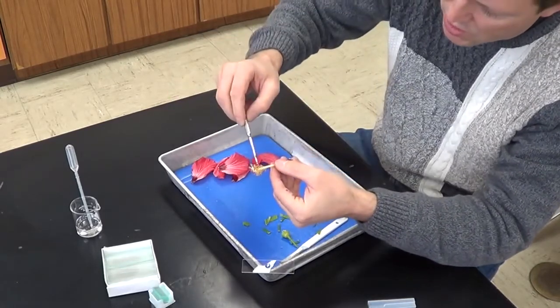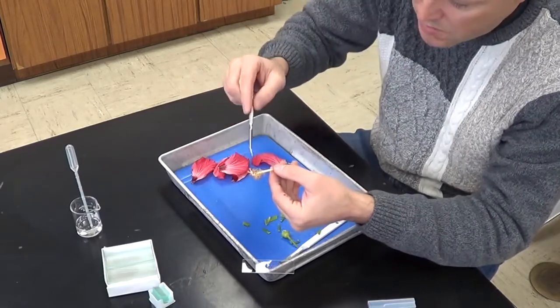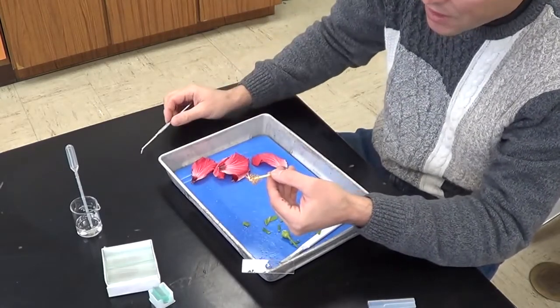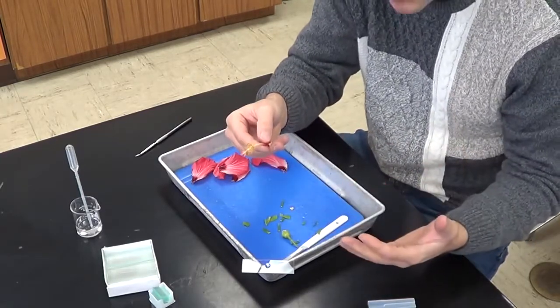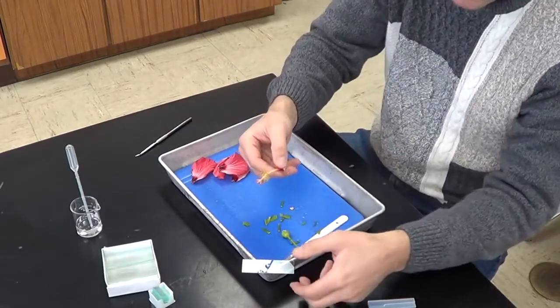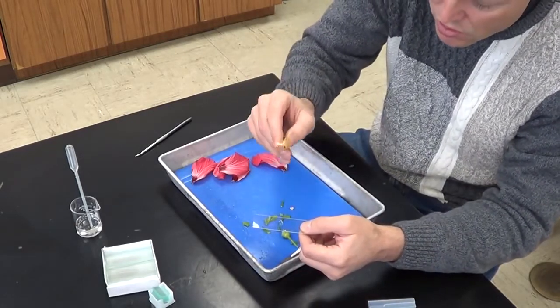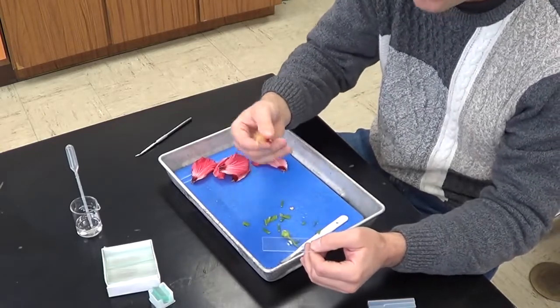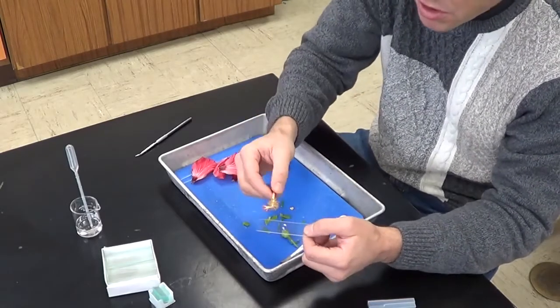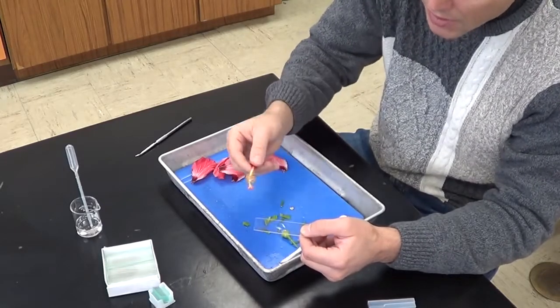And remember, these yellow structures here are the male part of the flower, especially up here. These are called the anthers. And the anthers contain pollen, they actually make pollen. And what I want you to do is just take it gently and strike it 3 times in the water, very gently. We don't want to get all kinds of other plant materials and debris in this water drop. So 1, 2, 3. And that's going to be enough.